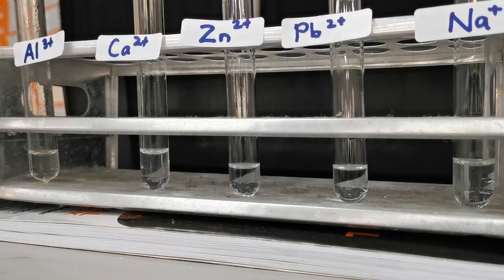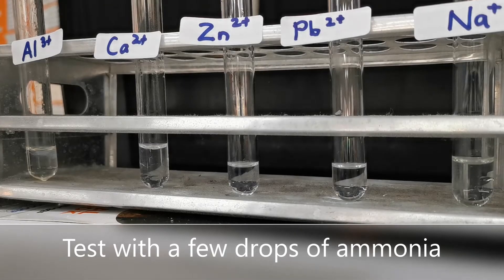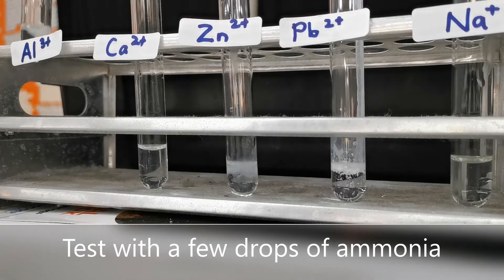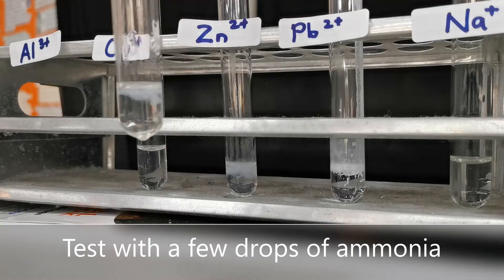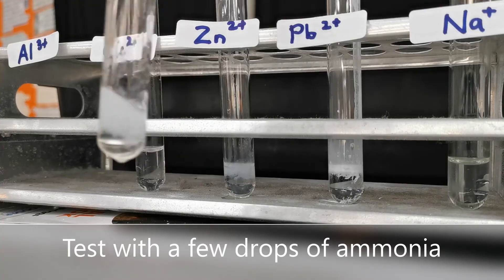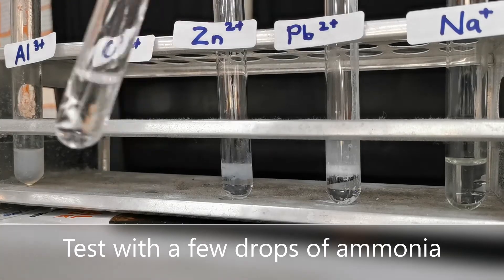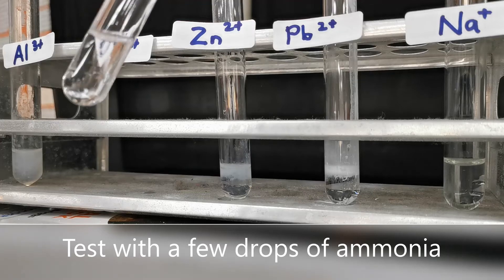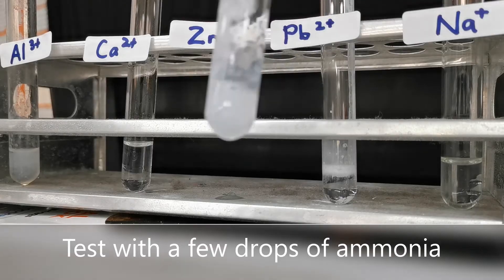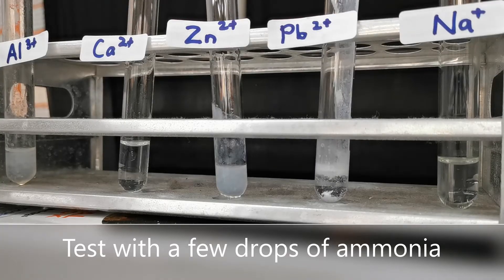Now we test for the same ions but using ammonia. Let's add a few drops into each of these test tubes. With a few drops of ammonia, the aluminum solution forms a white precipitate. In the calcium solution, there is no precipitate formed. Zinc also forms a white precipitate, and lead also forms a white precipitate with ammonia.